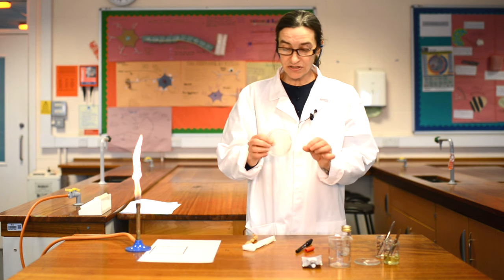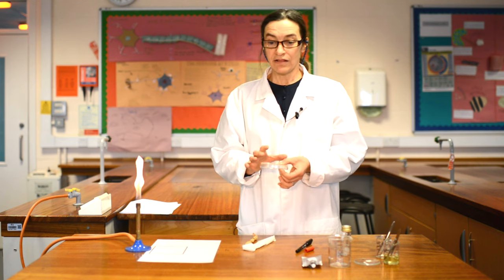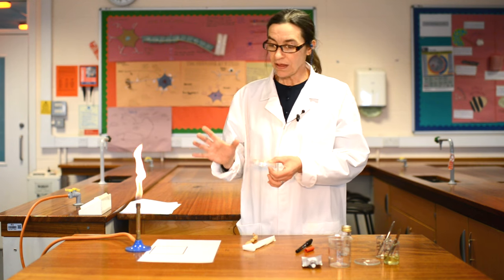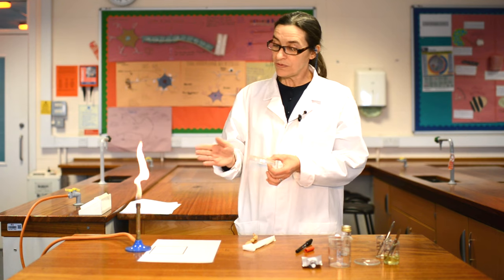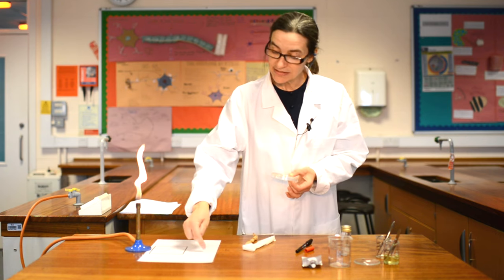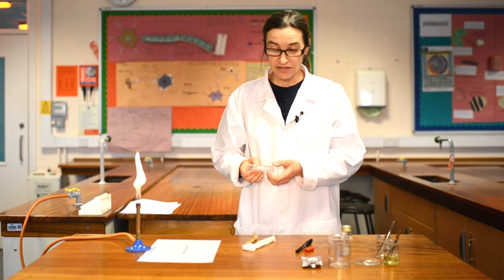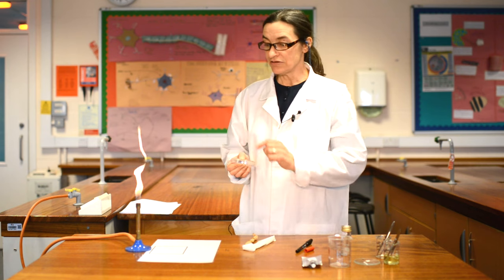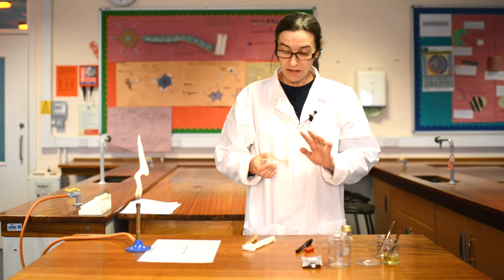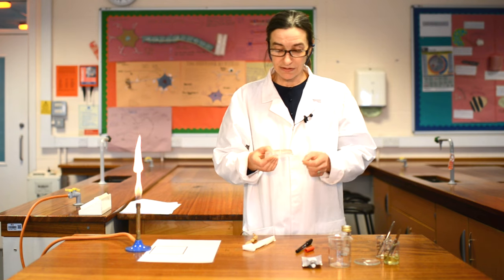You've probably worked with these before in school, but the most important thing is that you do not open the lid unless you really have to. And when you open the lid, you're going to open it near your Bunsen burner. Your Bunsen burner is what is going to create a sterile area where the square is on your workstation, and everything you're going to do is going to be within that sterile area. Do not pick it up by the lid or by the base.